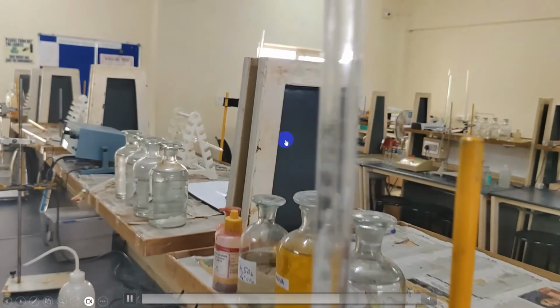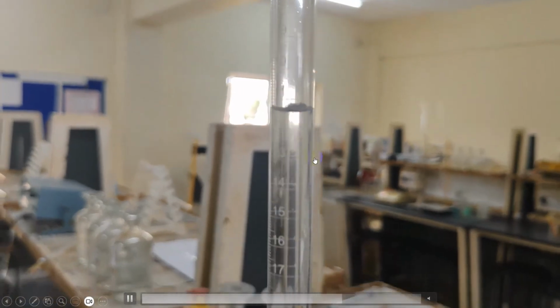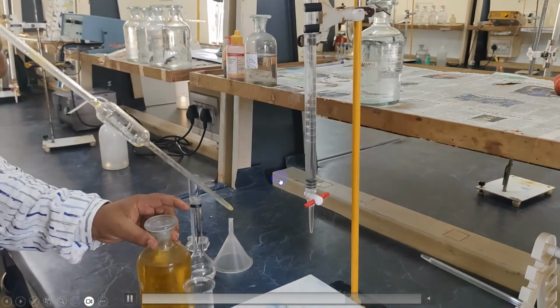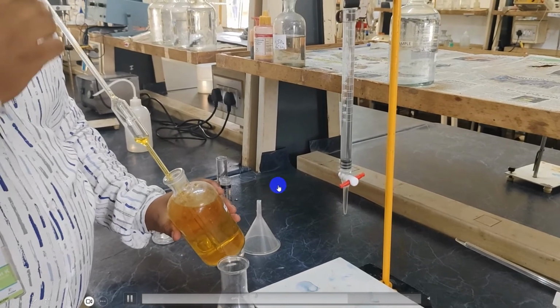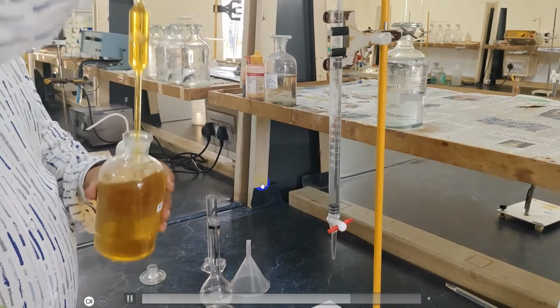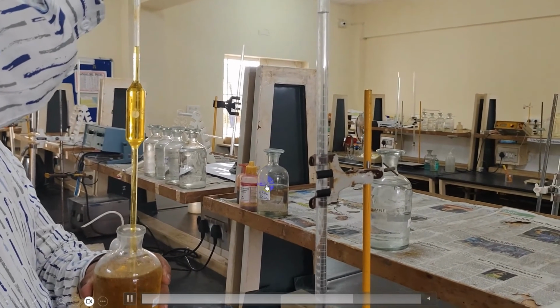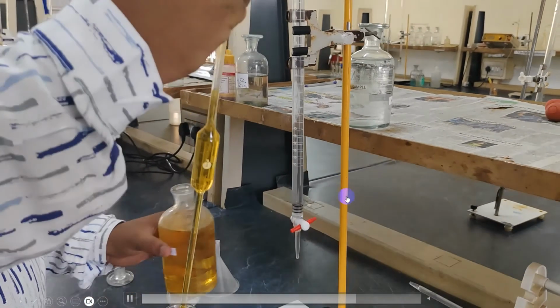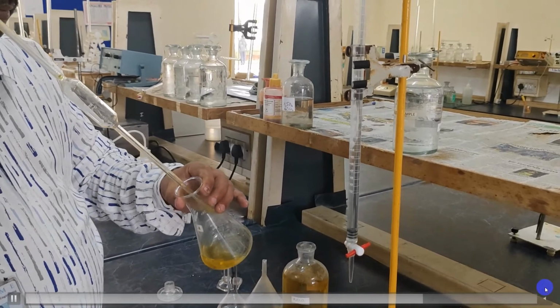In this case, the dichromate has already been used for oxidation of organic impurities, and we have obtained only the remaining dichromate solution. So we have to also perform a blank experiment where we take the same quantity of dichromate which we had taken in the previous step, around 25 cm cube. It will be transferred into the conical flask, and ensure that we should not add the water sample here. Once it is added, we have to follow the same steps as previous.